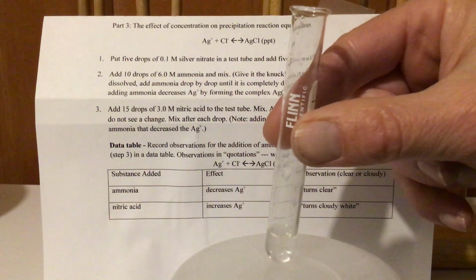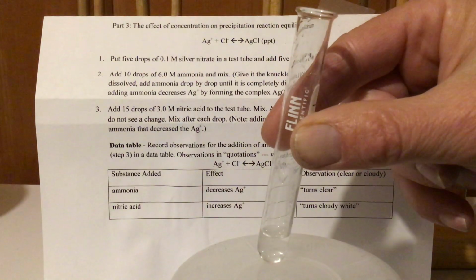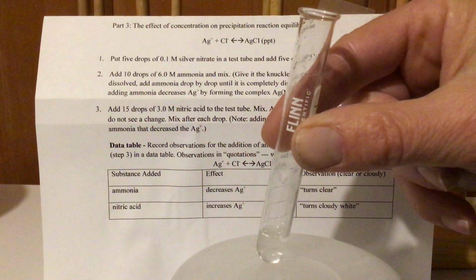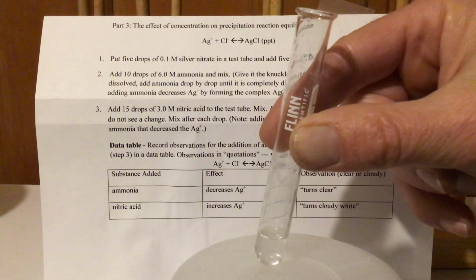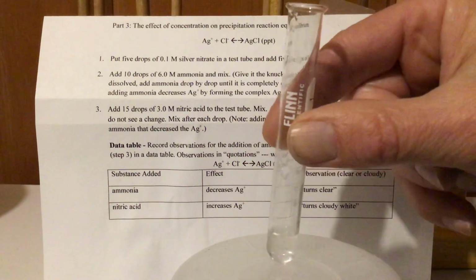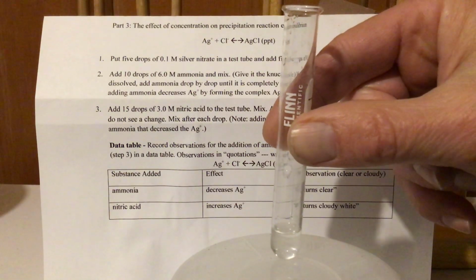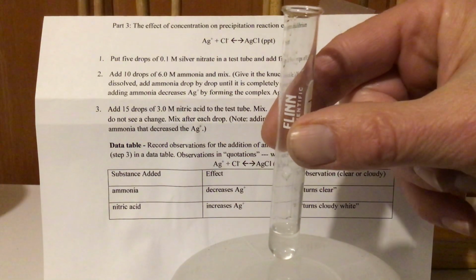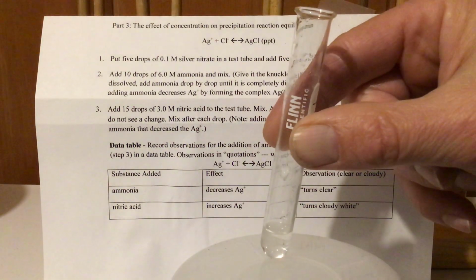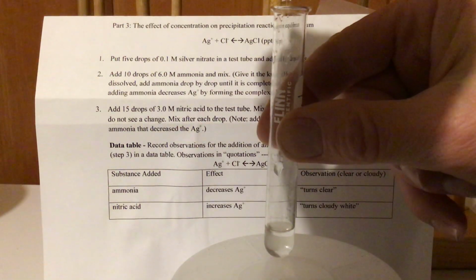What if I wanted to maybe bring back that precipitate? I'm going to put the cap on this ammonia. It's rather strong scent right here. I don't know if you can smell that where you're at, but I can. All right, and I'm going to grab some HNO3, which is an acid, and essentially the acid's going to neutralize the ammonia base and bring things back to where they were. So I'm going to cancel out the last step. It's really going to be like adding Ag+ and shift the equilibrium back the other way, and let's see what happens. And we'll put the drops in.